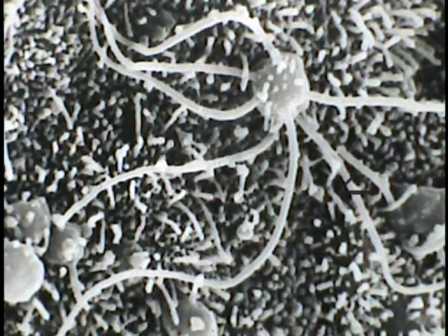And what it demonstrates three-dimensionally as one views down on the surface of the olfactory epithelium is the olfactory knob or olfactory vesicle as shown here at the arrow. And it also shows the elongated cilia that extend from the olfactory knob or vesicle and lie parallel to the surface of the olfactory epithelium.